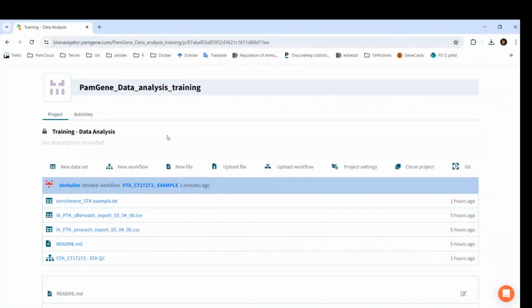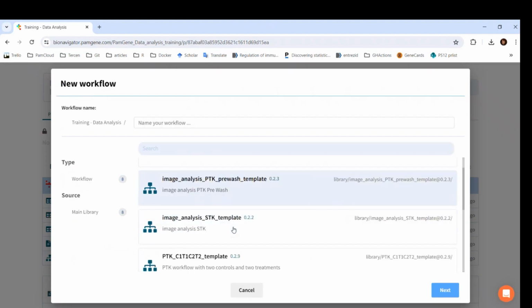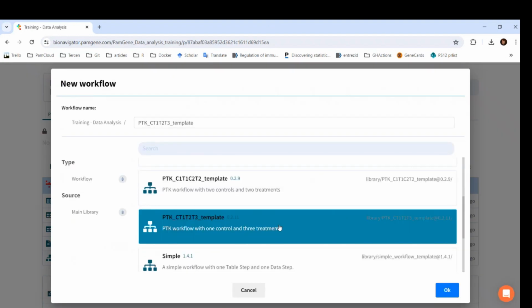I am working from the PamGene Data Analysis Training Team, Data Analysis Project. You guys, however, please work from your own team in the same project where you have done the image analysis. For this training, you also need to run the PTK afterwash workflow because the export file is also needed for the PTK data analysis workflow. Let's add a new template. We need to select the correct template type based on the experiment design. Now I will select the CT1, T2, T3 template.